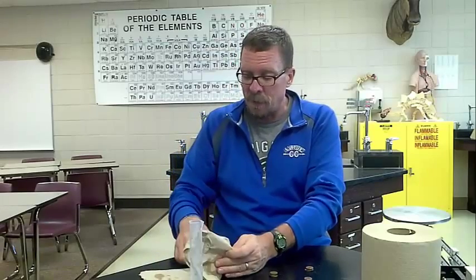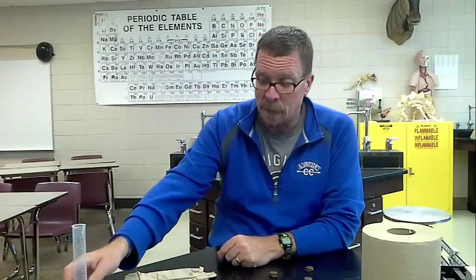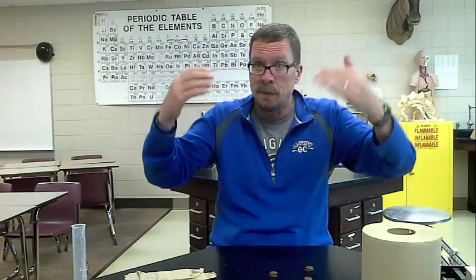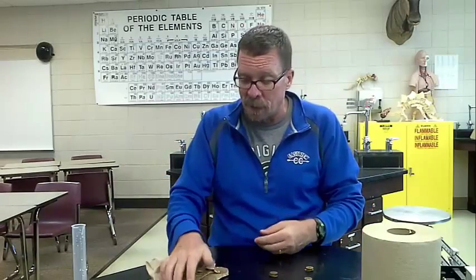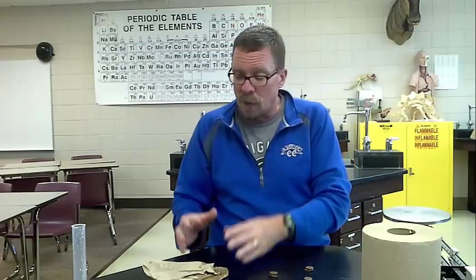After the lab is all completed, I can then start calculating the densities, and we'll talk about that in class. But first, one group set of data is never enough in chemistry or any scientific lab experiment. You need multiple sets of data to improve your accuracy. So part of the reason I'm trying to dry these so well is once I've done my first set with my table mates, I am going to dry off all these pennies. I'm going to take both my sets, go to another group, and trade. And then I'm going to do that second set.